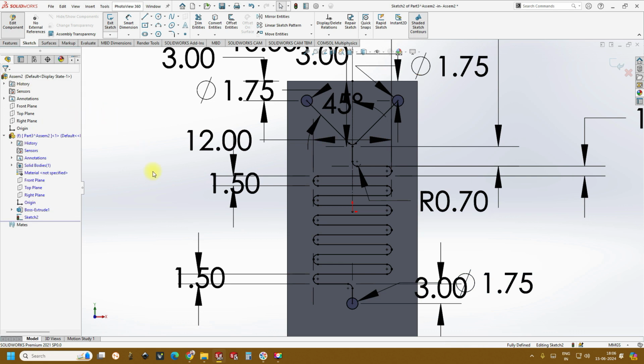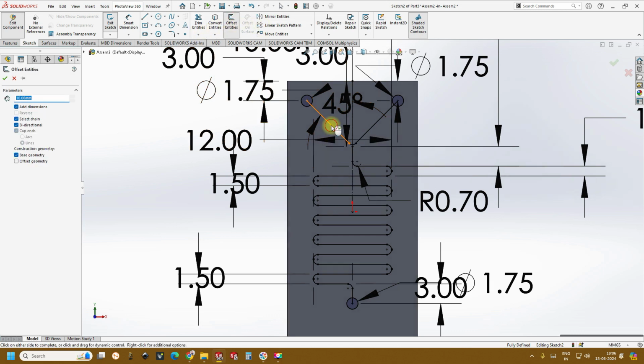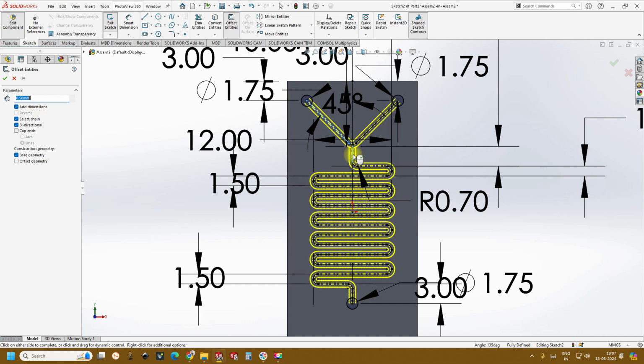So once it is done, the next thing is we have to create an offset. That is when we see the channels. Now these are only just the lines. So go to offset, select this and change the dimension to 0.5. Now if you see, these are the selections that are already there, bidirectional, and capping the ends is not needed in this case. So let's untick it, and base geometry should not be interfering with our 3D profiling, so create the base geometry as the dotted line. And once it is done, select all the profiles, and this is how beautifully you see the serpentine channel.